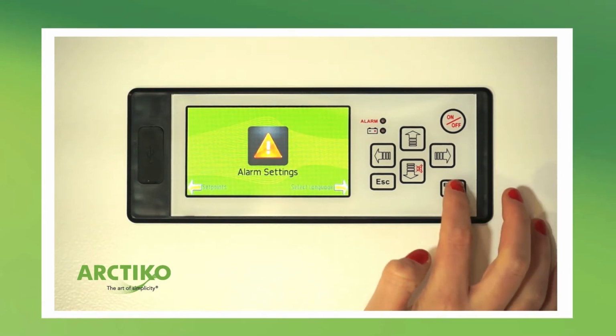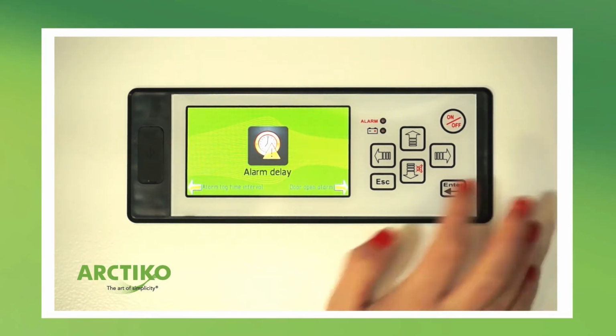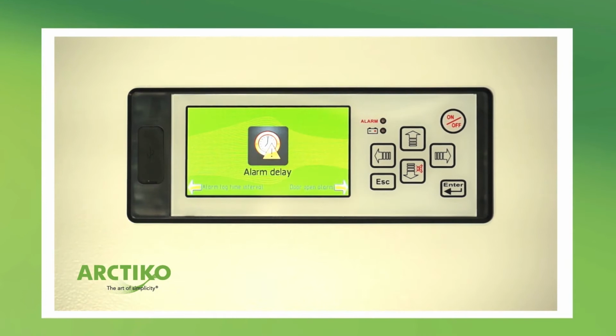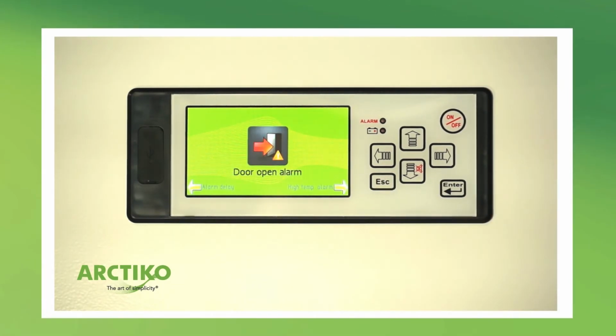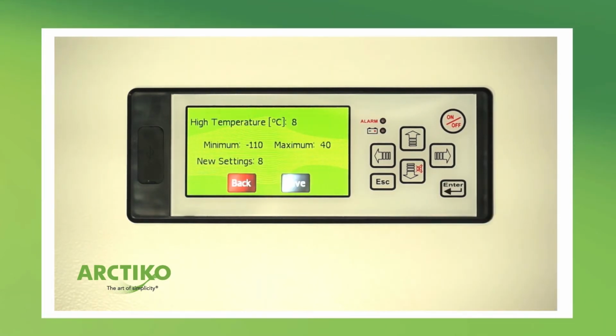In alarm delay, set the time from an alarm will occur on the unit and until it will be shown on the display. In door open alarm, choose if the alarm is enabled or disabled. In high temperature alarm, set the highest temperature the device can get inside before the alarm starts.